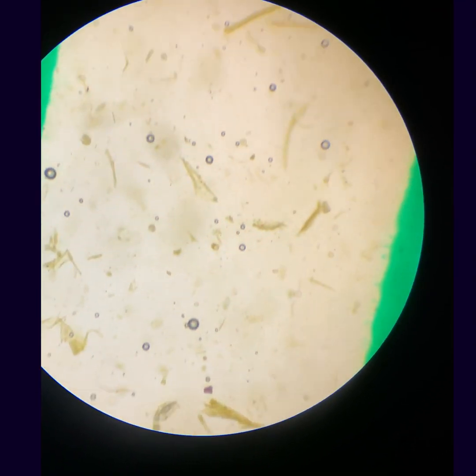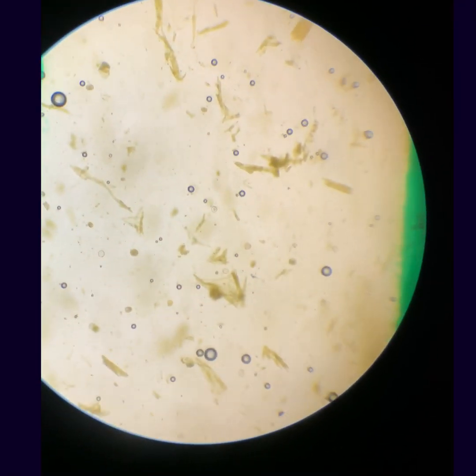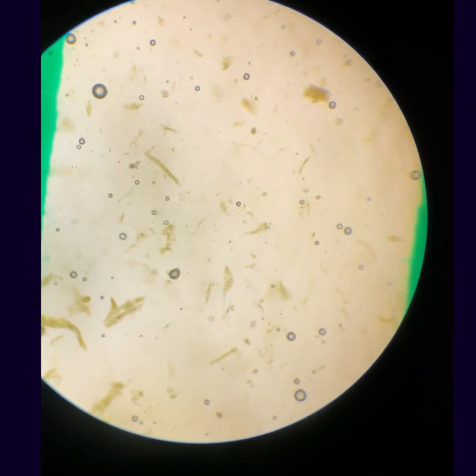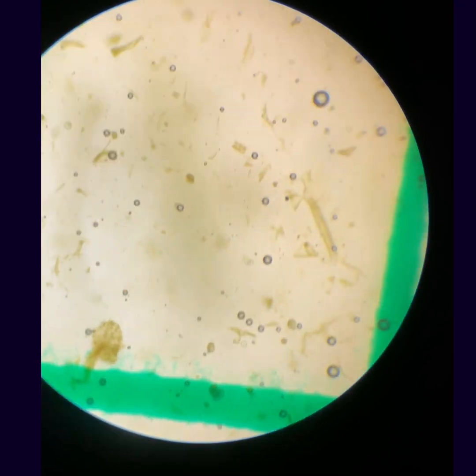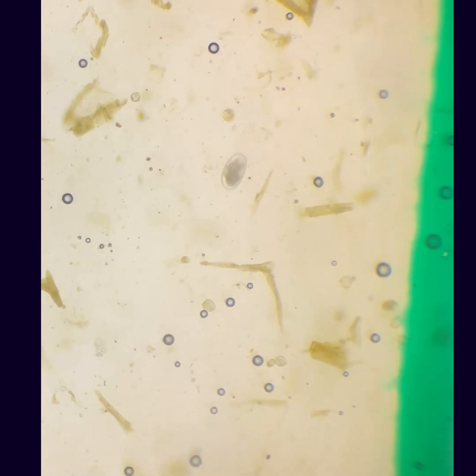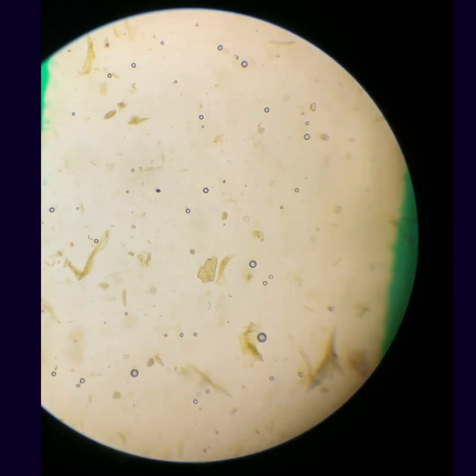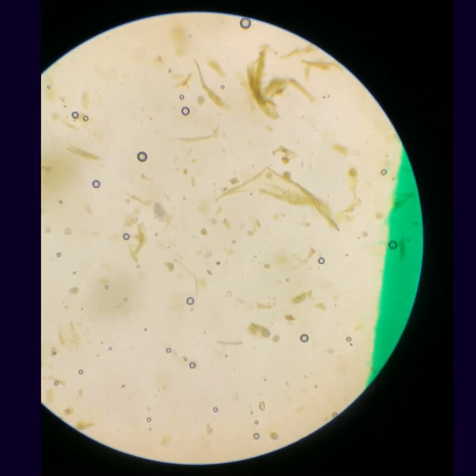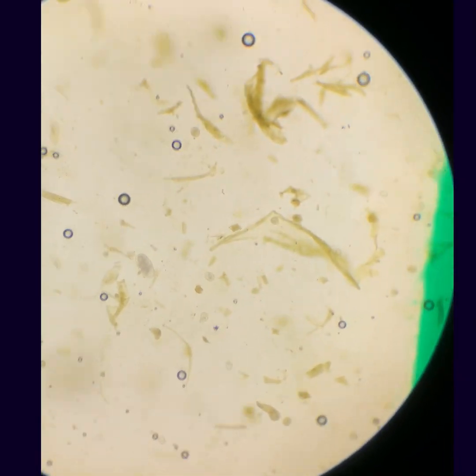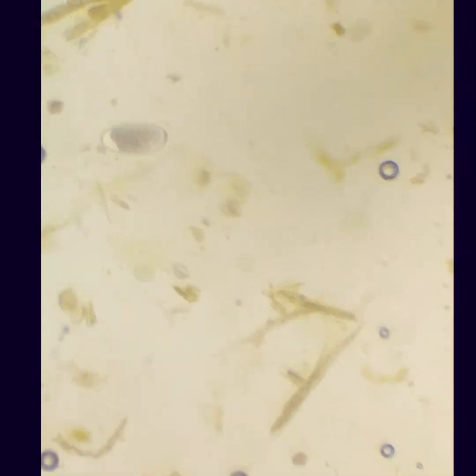Once we've got the slide under the microscope, we start counting the eggs between the green lines. We count both sides of the slide and that gives us a total count for the sample. To get our eggs per gram, we multiply this number by 50. Anything over 150 eggs per gram and we'll be looking at worming the horse. This horse came in at around 800 eggs per gram, which is relatively high — not the highest we've seen; the record is around 3,500. This is a mild to moderate increase in egg count.